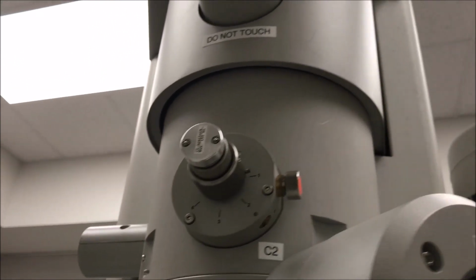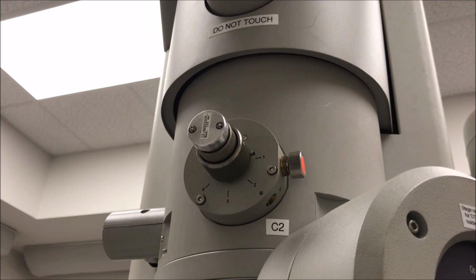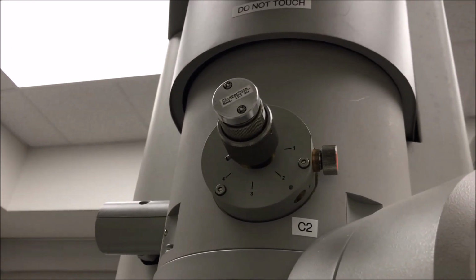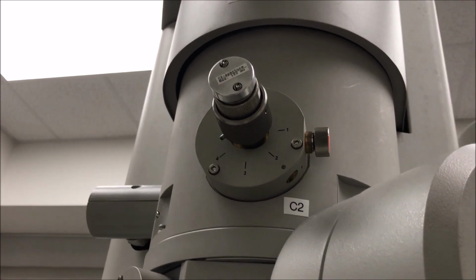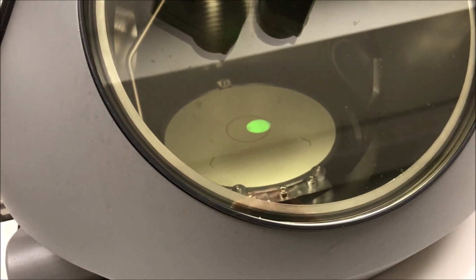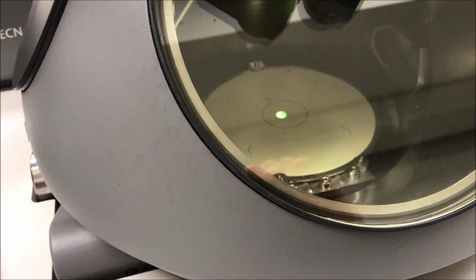As I was doing high-res STEM, I've got in the number 1 C2 aperture. Normally for just regular TEM, I put in the number 2. But what I'm going to do now instead is put this on the 4, which of course is the largest C2 aperture. So I've got spot size 1 and C2 aperture 4, so I have a tremendously high current that's reaching the sample. I'm going to go ahead really quickly and roughly realign the C2 aperture. Again, come back here, adjust to bring it back. I'll do one more iteration, that should be enough.